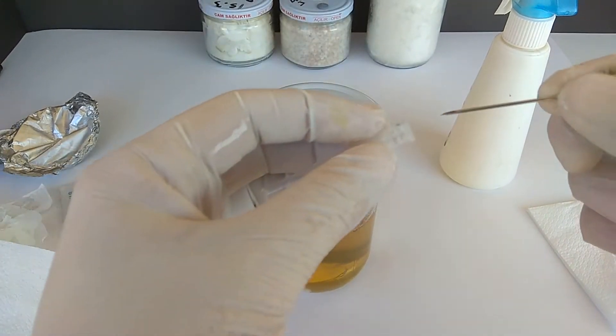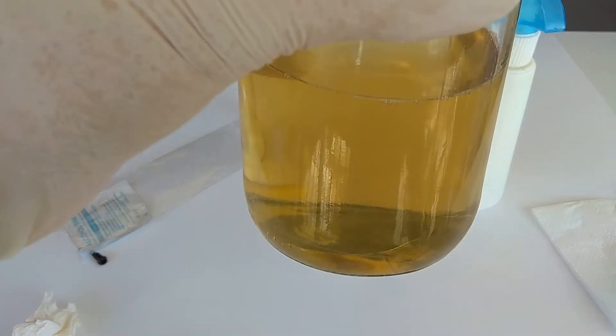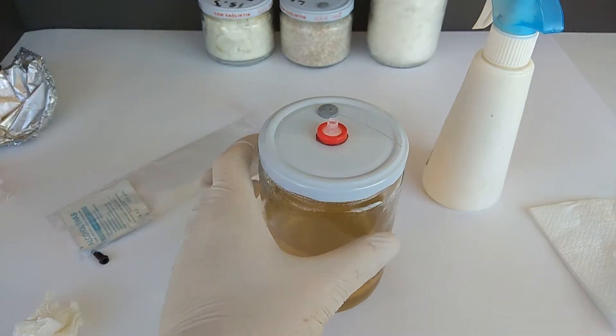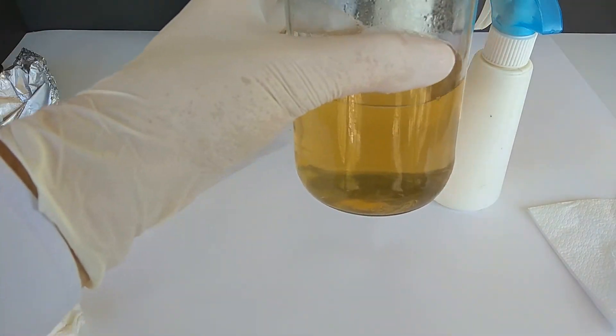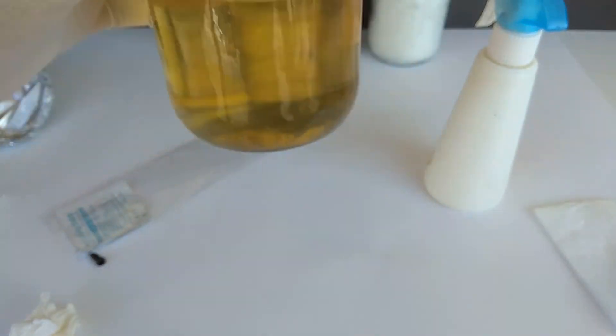That was the transaction. The liquid in the jar may appear blurry in the first days due to the caramelized sugar. However, as the hyphae grow, the fluid will become clear and the hyphae will begin to appear clear. For 20 days, I will stir the jar for 1-2 minutes every day.